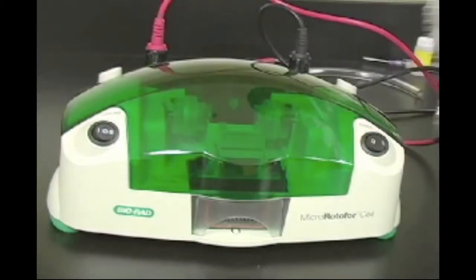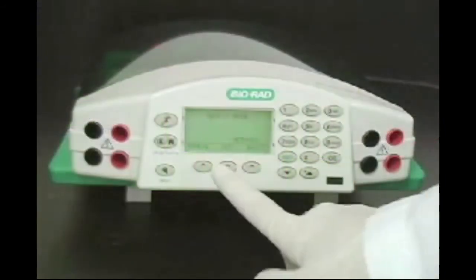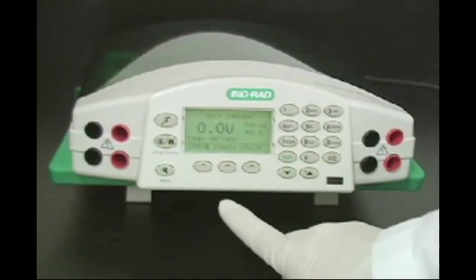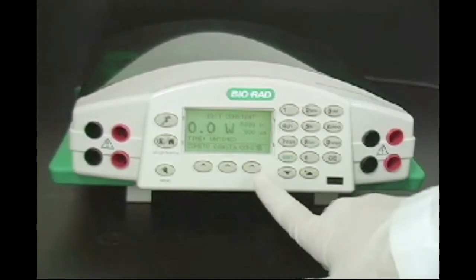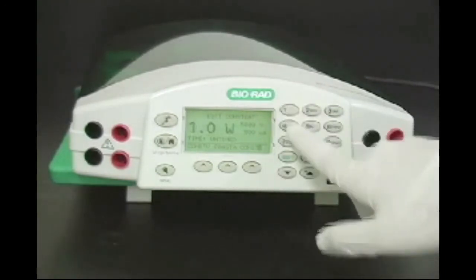Turn the power switch on and set the cooling switch to setting 2. Use a power supply capable of power control at 1 watt. Bio-Rad's PowerPak HV power supply is recommended.